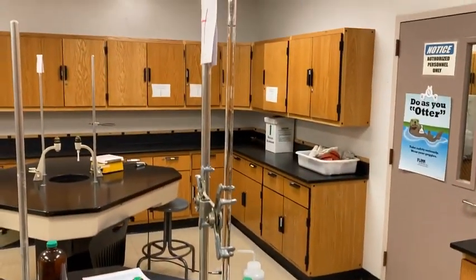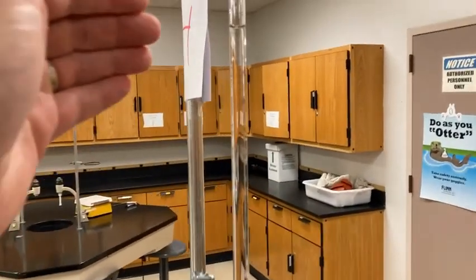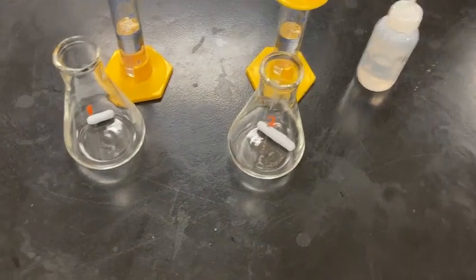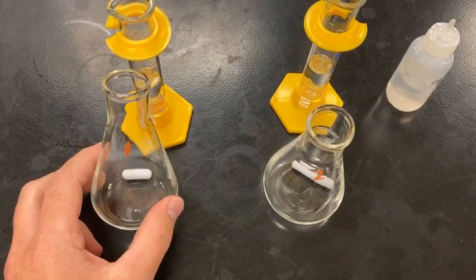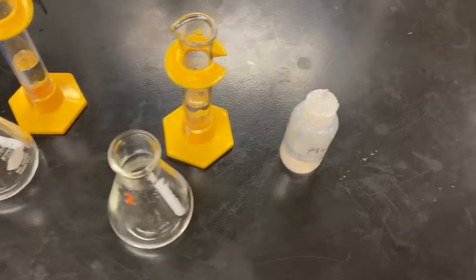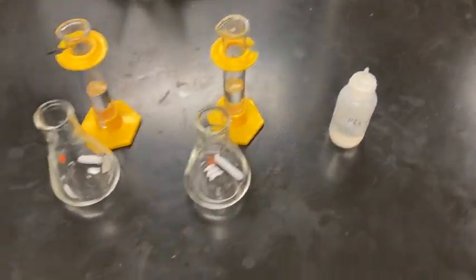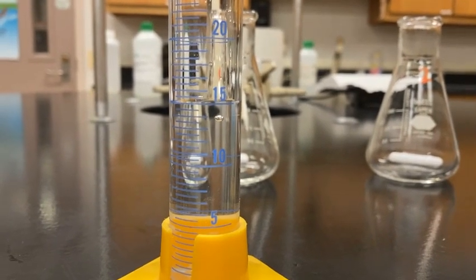I'm going to be titrating today with what the lab suggested, 0.1 molar NaOH, and I have that filled in our burette already. And I thought I would start off with 2 trials for each, and then we can see an average for our 2 trials. If we need to do a third trial, we'll cross that bridge if we need to. And the indicator I'm going to use today is good old phenolphthalein. So we're going to be looking for that light cotton candy pink to stop the titration. All right, let's begin by collecting data for our 2 trials.